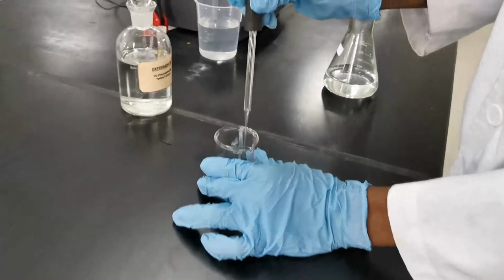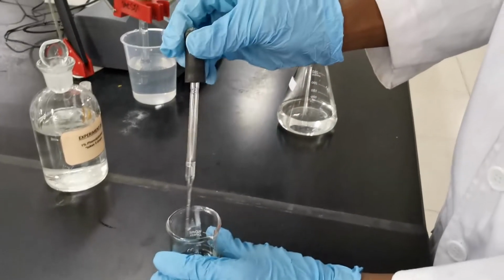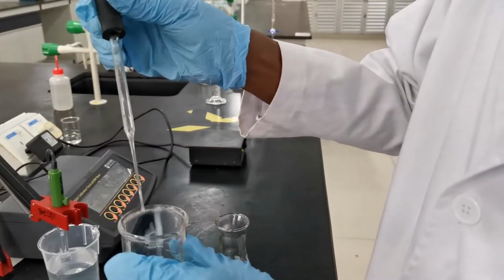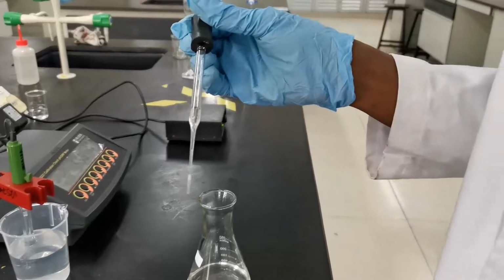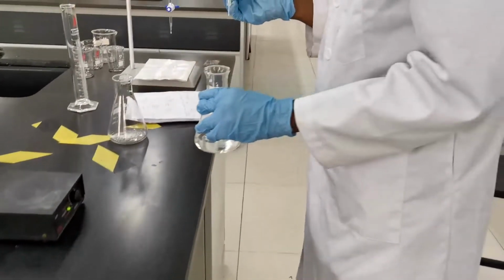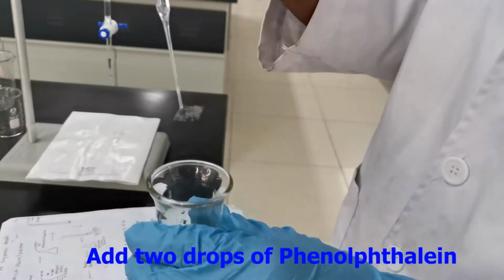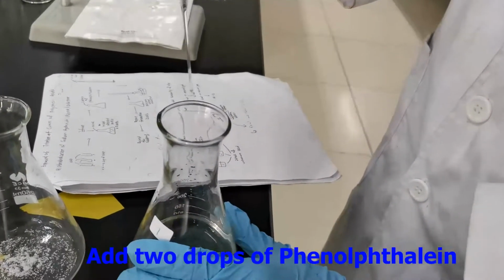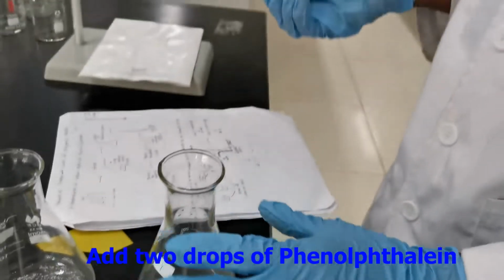So it's where I will be taking my drops. You can see, just 2 drops, carefully. 1, 2.